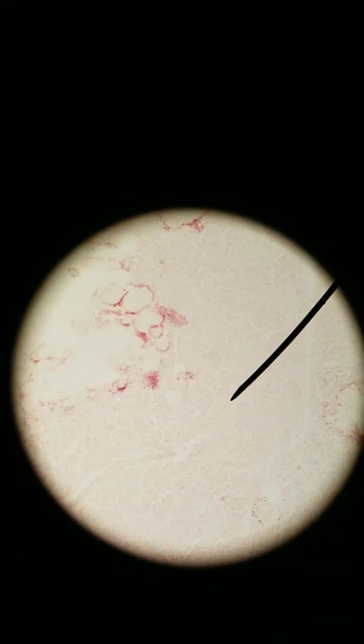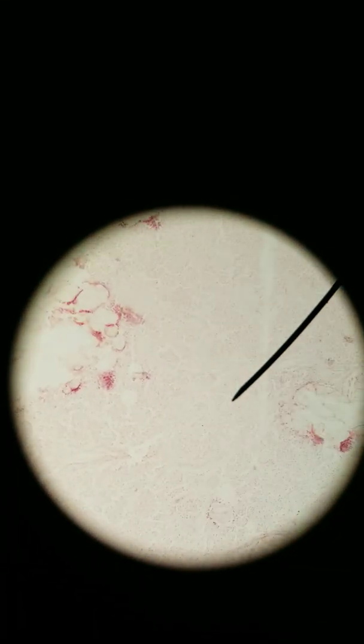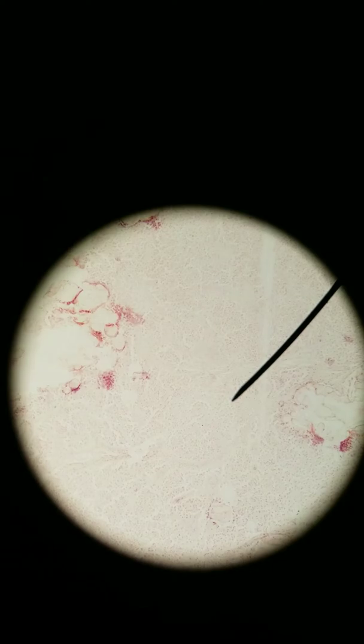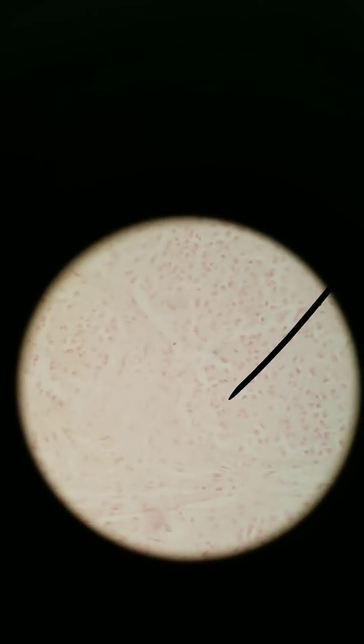We're going to go to 100x. We can start to see cells here, and a bunch of other things, which I'll get to in a second. And then 400x. Honestly, there's nothing too remarkable about the histology here — there's a bunch of cells.